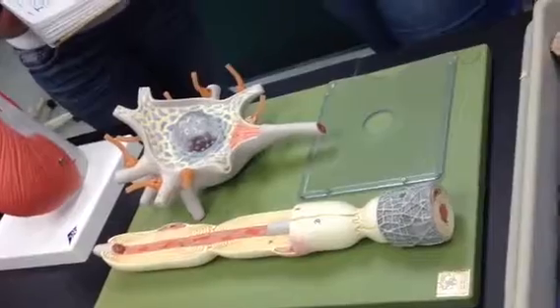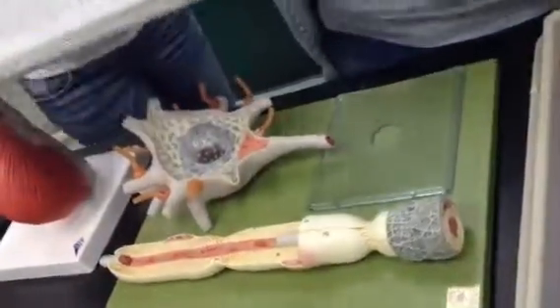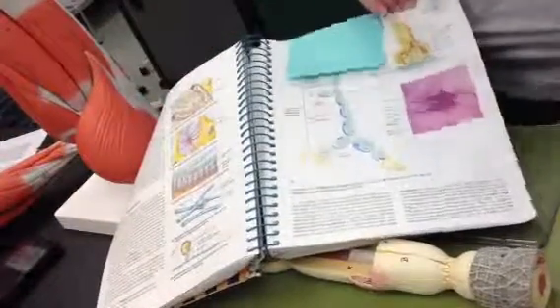This is the oligodendrocyte, by the way. That's what it looks like. So here, just really quick so I can move on. This is what a Schwann cell looks like, these individual little bulbs. And this is an oligodendrocyte. See how there's one cell body there, one nucleus and everything, and it goes on to different axons and wraps a whole bunch of different things. So Janelle, let me clarify.